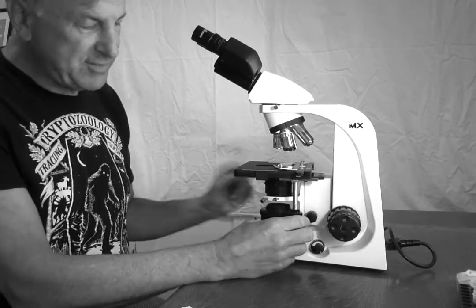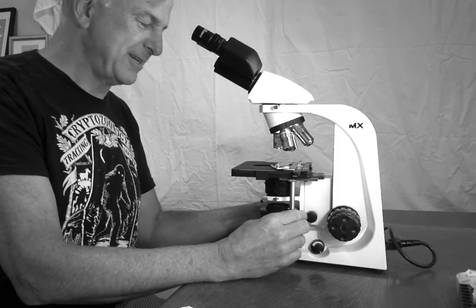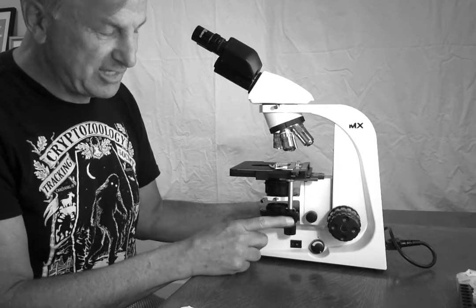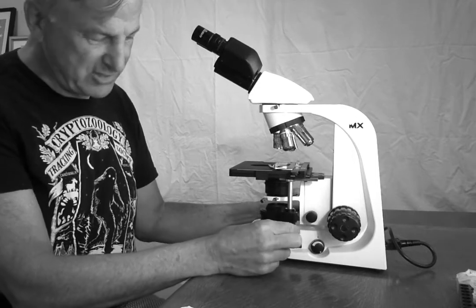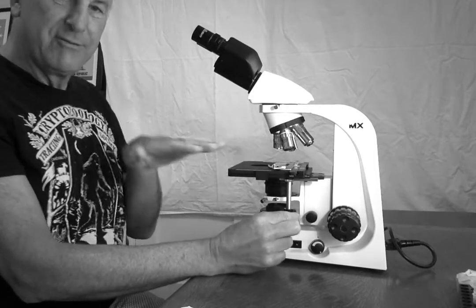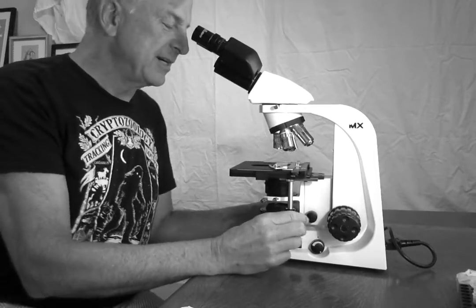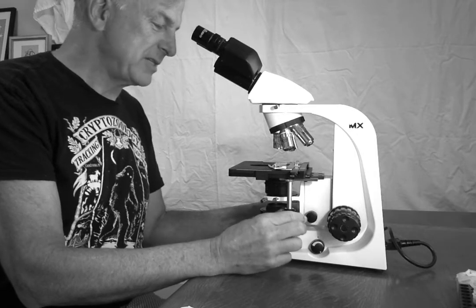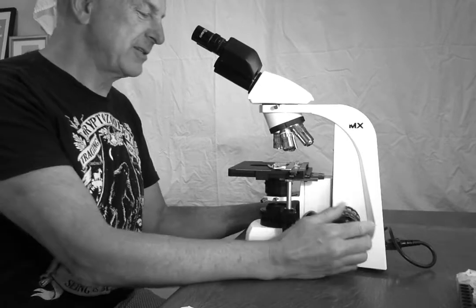Now I have some adjustments to make. I can see that my slide is not over the light that's coming through. So I am going to use the stage adjustment knobs. They move this in two directions, the bottom knob left and right, the top knob forward and back. So it controls the X, Y coordinates for my slide until I see something in the light. I do see something, so I think I've got something under there.